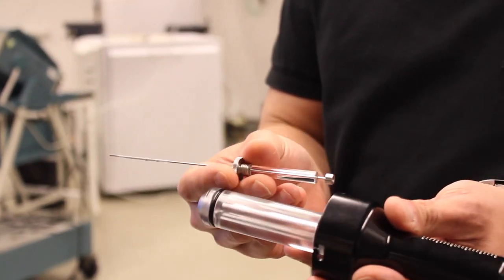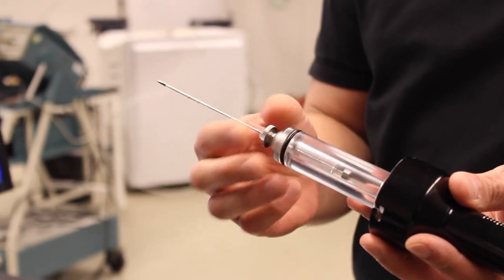Step two is telling you if the syringe was installed, which would be like this, then you should remove it, set it aside.